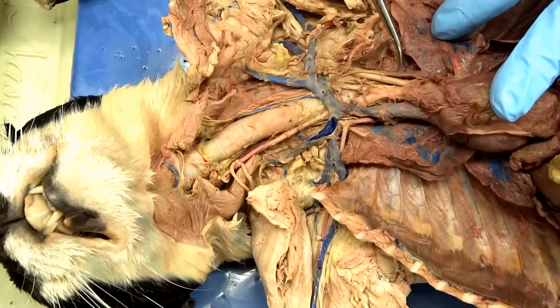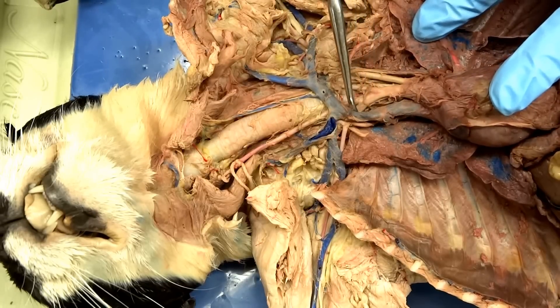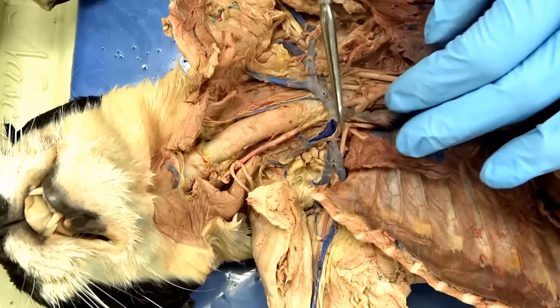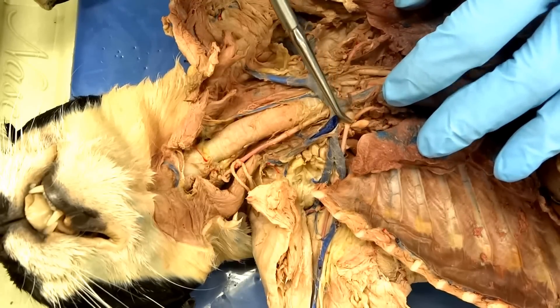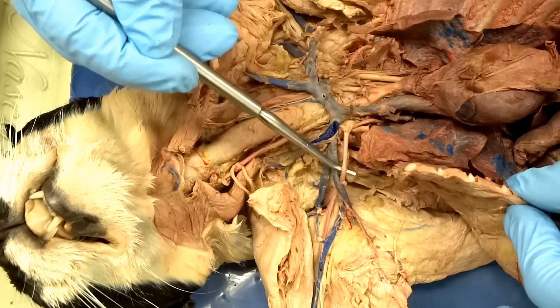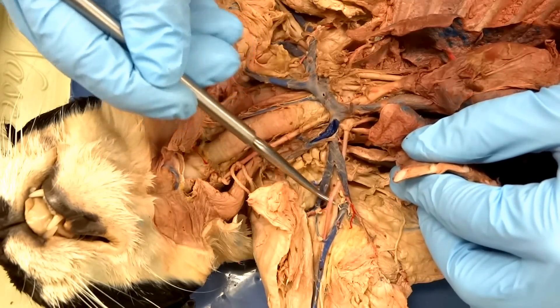On the human we had three branches; on the cat there are only two. So we're going to follow the brachiocephalic first — it is going to branch three times. The first branch is going to go off to the right side; this is the right subclavian artery. If we follow the right subclavian artery off towards the arm — there's a knot in there — going underneath the rib cage, it will turn into the axillary, and we follow it all the way out to the brachial as it moves into the arm.